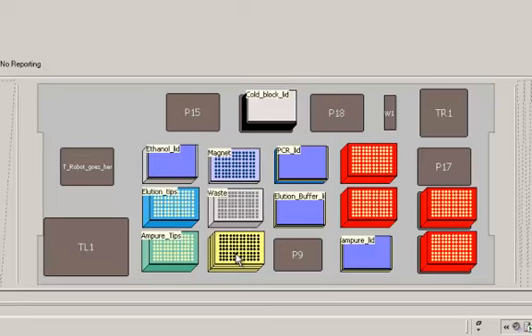I know I couldn't go over all the details in the method and the development. It would just take too long. I urge you to run it in simulation many times. Get so you understand the method before you run with real hardware. But this should help process samples for the PacBio in either a semi-hands-off manner or a fully hands-off manner if you have an onboard thermocycler.